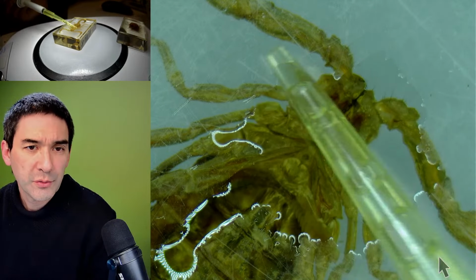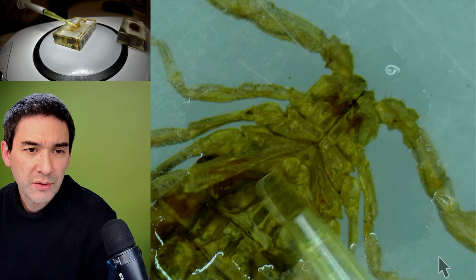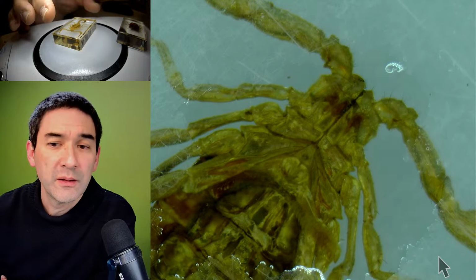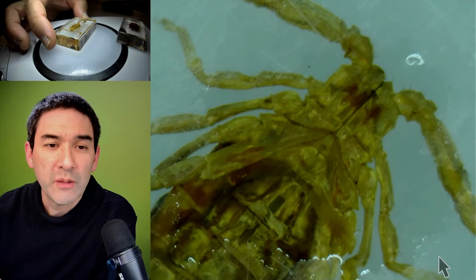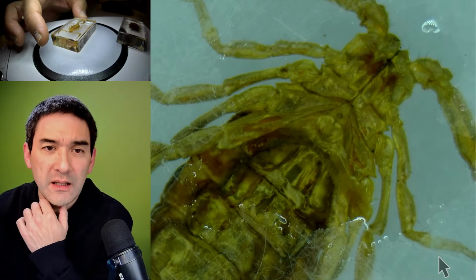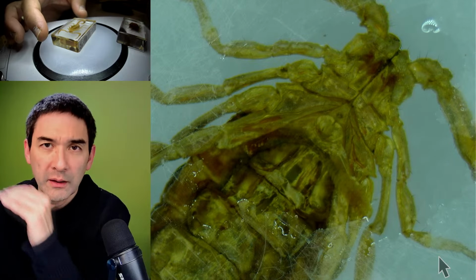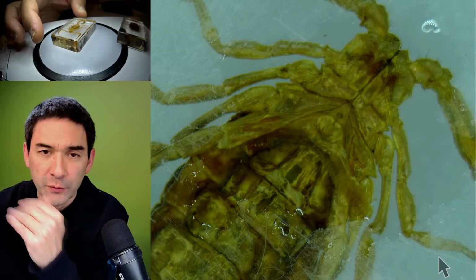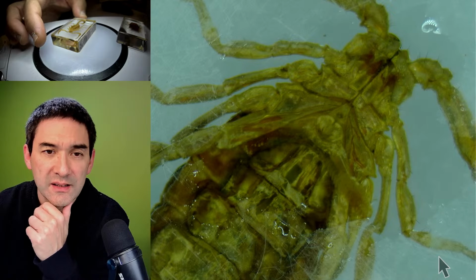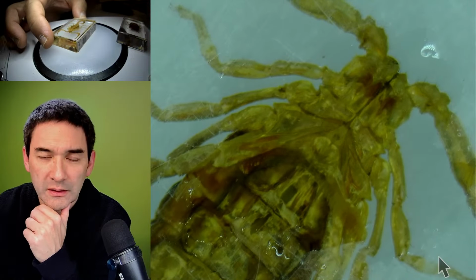Yep, it also removes those scratches. Good. Yeah, I'm happy that this actually works. It works similar to immersion oil. Well, let's put it this way: it evens out differences in refractive index. Because the oil fills the cracks of the scratches, the light doesn't bounce around, and in that sense it makes the quality a little bit better.